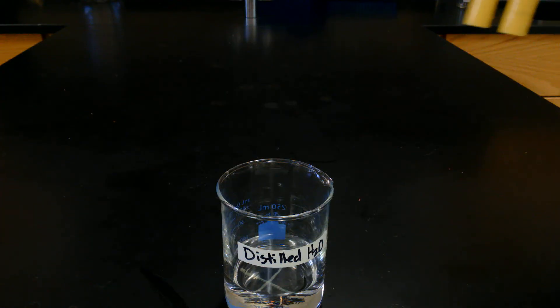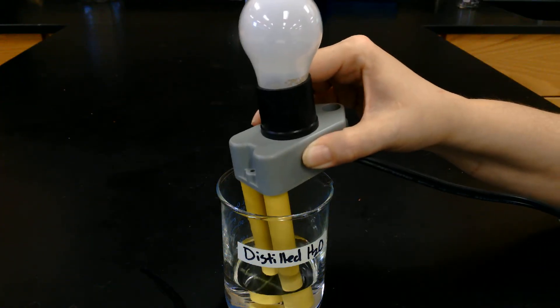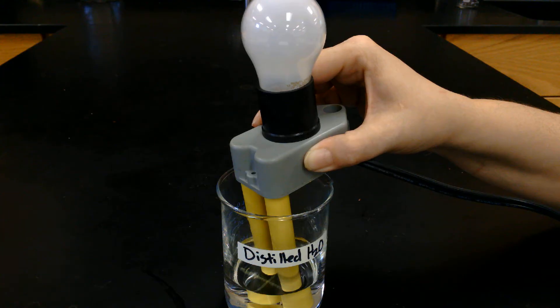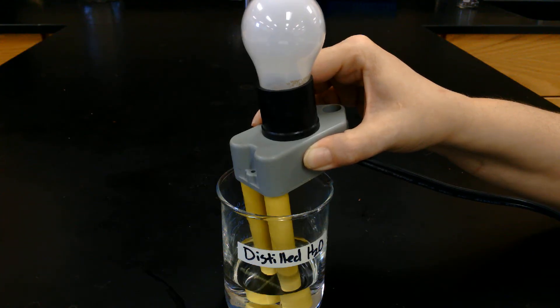Here's distilled water. Go ahead and make your observations.